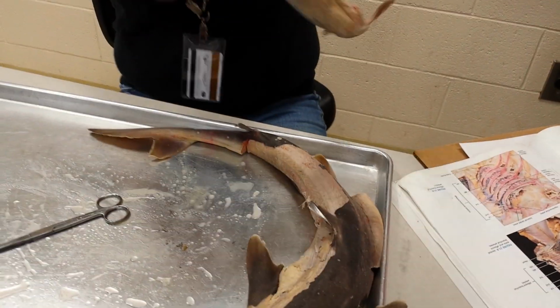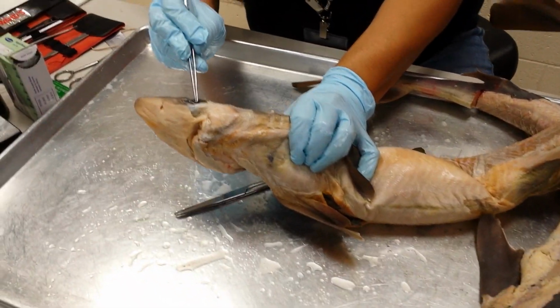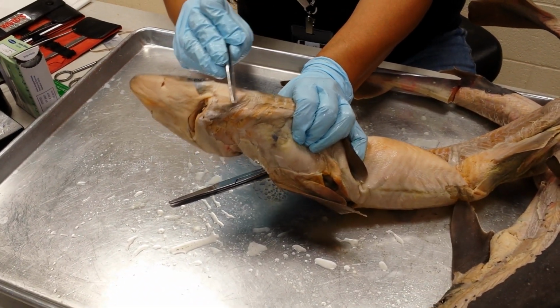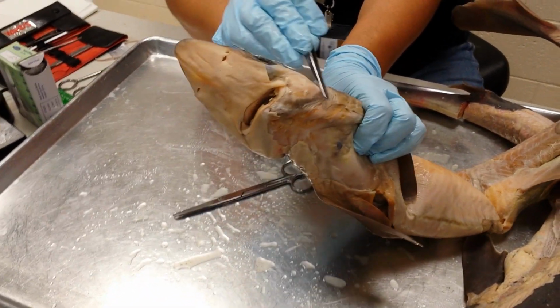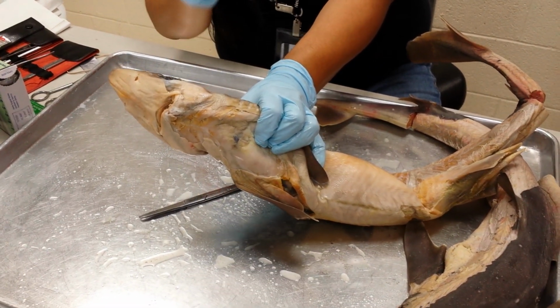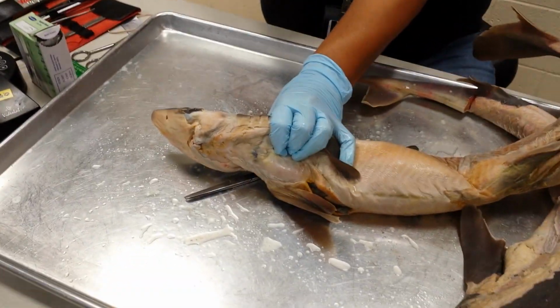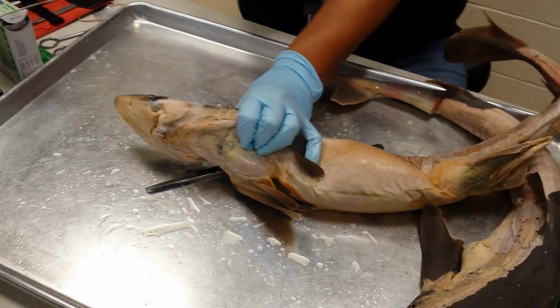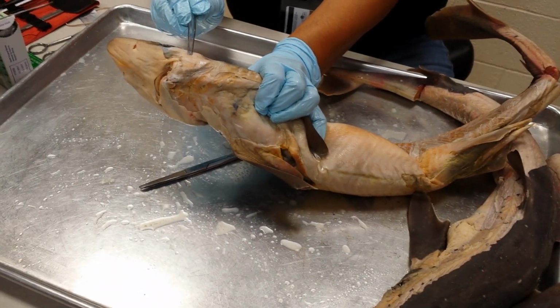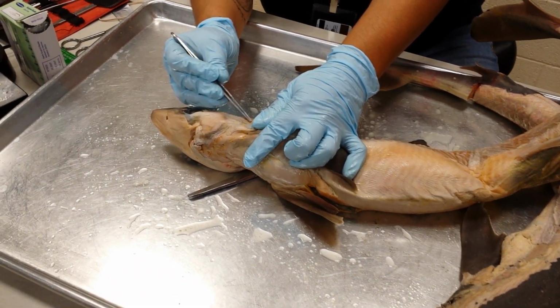If I look around the side, just caudal or posterior to the eye, there's this big round muscle here. It's like the cheek muscle. That's called the adductor mandibulae. Adductor, so it's closing the mouth. It's adding the bottom jaw to the central body line. Okay? Adductor mandibulae. If we look just caudal to that, there are two strips of muscle.